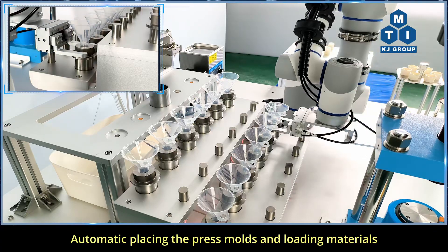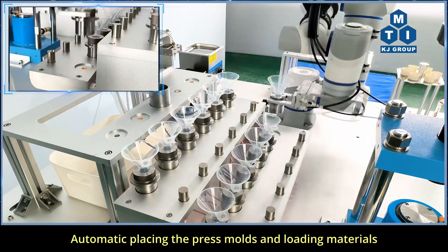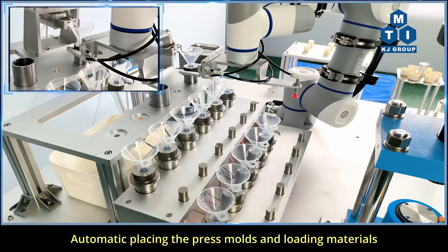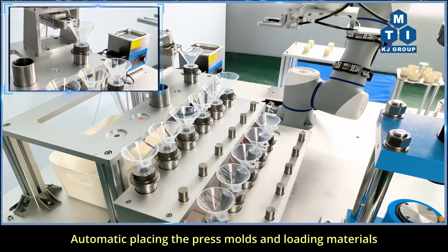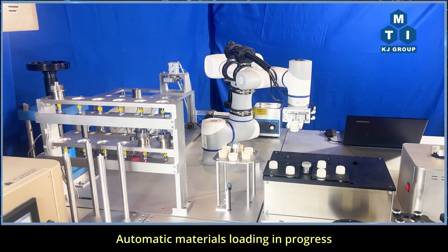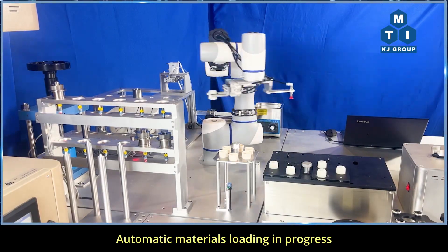Automatic placing of press molds and loading materials. Automatic materials loading in progress.